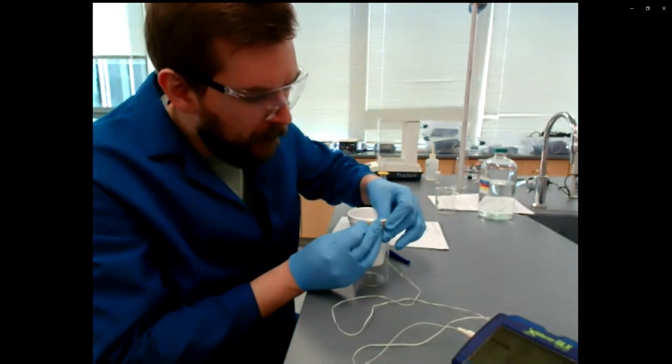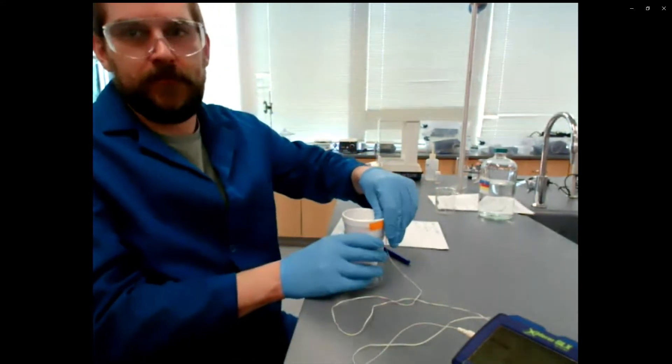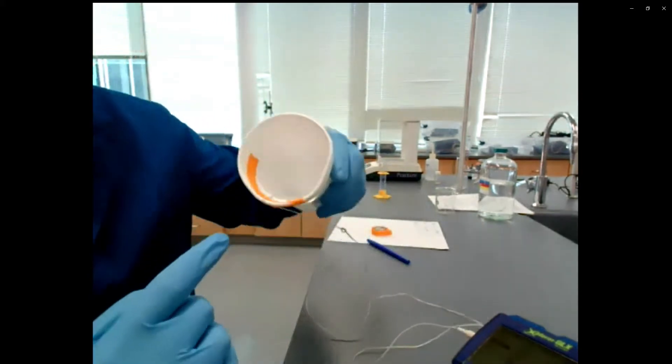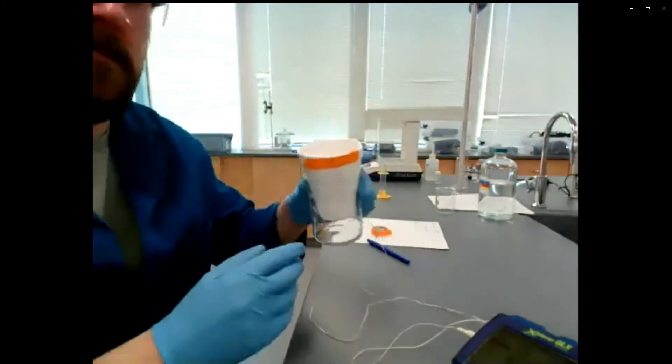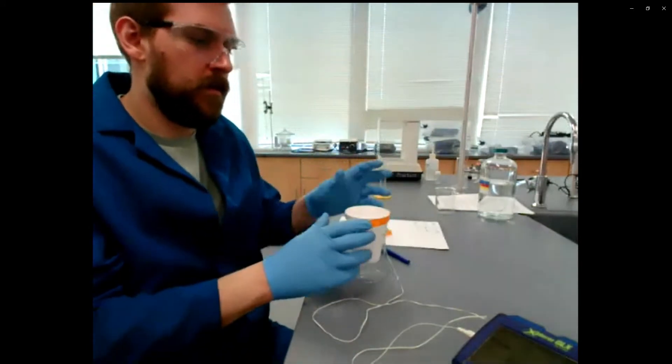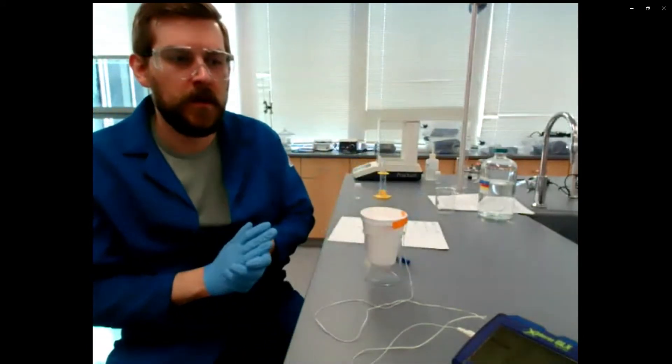To use this calorimeter for all of the data collection, you'll do like five or so reactions. I've taped it to both sides of the cup. And in the very bottom, you can see the temperature probe. So that's all set up.